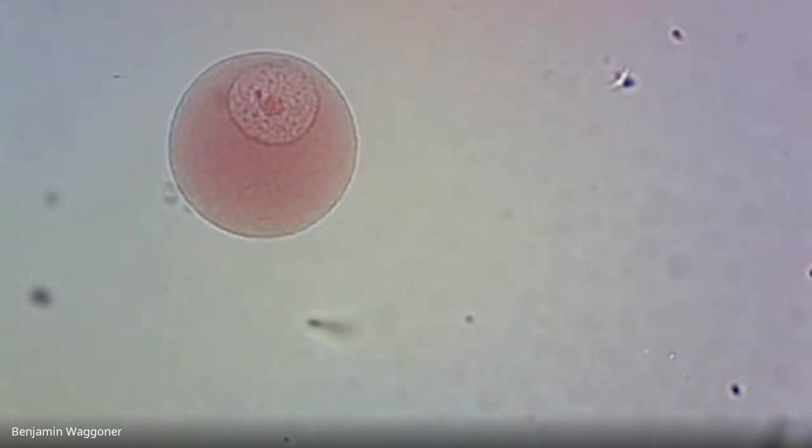All right. Lab 5 is about developmental biology, specifically the development of sea urchins. And I want us to start with a bit of a look at prepared slides just to get everybody ready for what's to come. Now, what you're looking at is an immature egg, and this happens to be a starfish, but the early stages of development are very similar for pretty much all echinoderms, certainly all the ones we need to concern ourselves with.